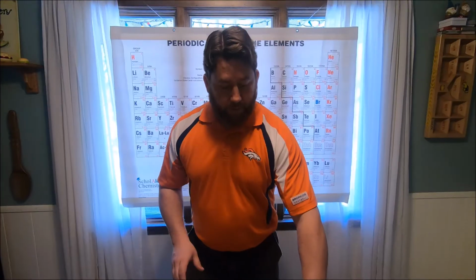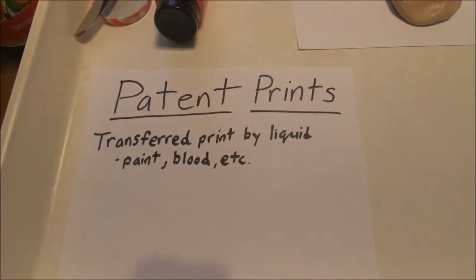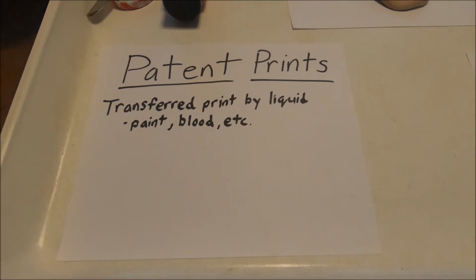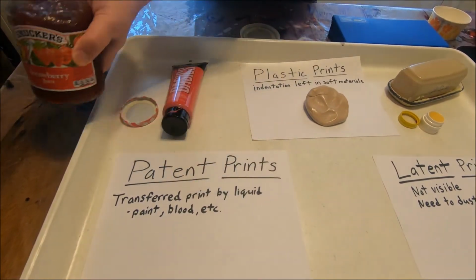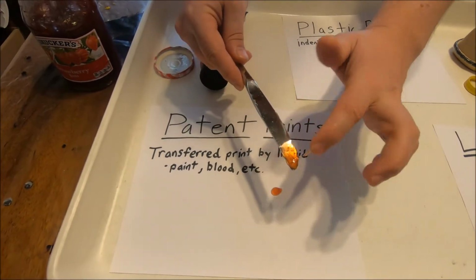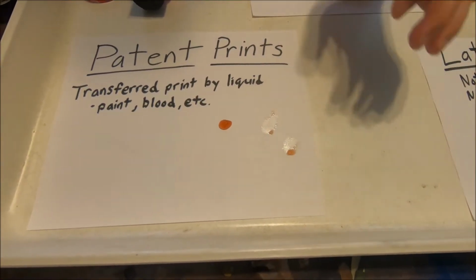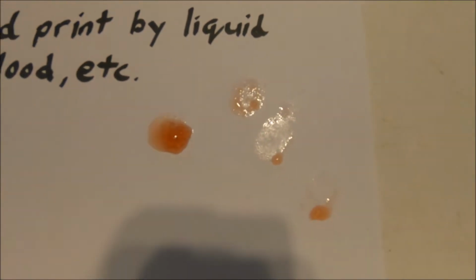The second type of print we're going to look into is going to be known as a patent print. A patent print is going to be a print that's been transferred by some kind of liquid, maybe a paint, blood, etc. I'm going to start out, I've got some Smucker's jelly. So if I had to take a little bit of jelly, and if you were to, say, touch that material and get a little bit of jelly on you, and then be able to actually touch somewhere else, we might get a visible print to show up from there.